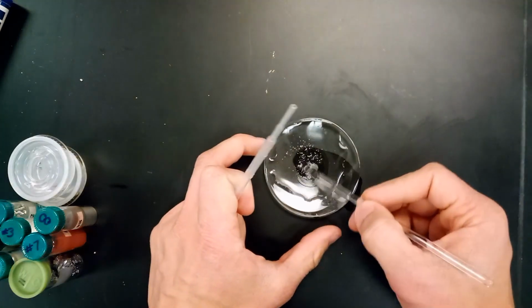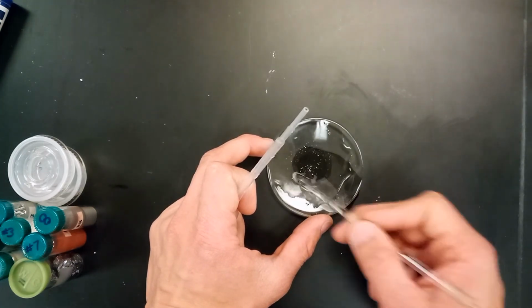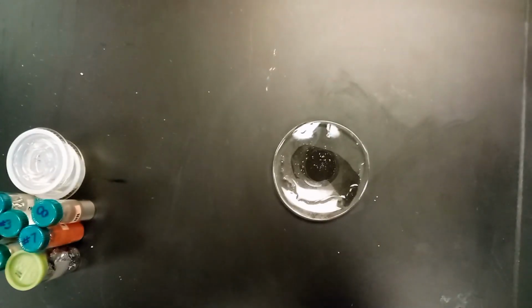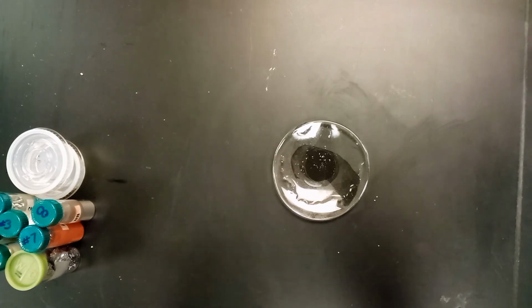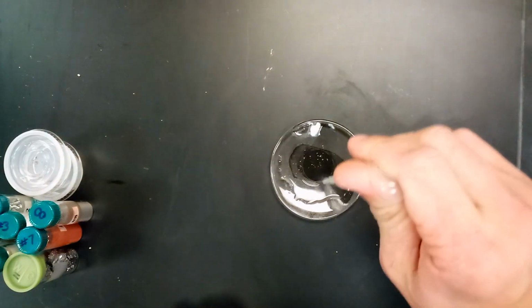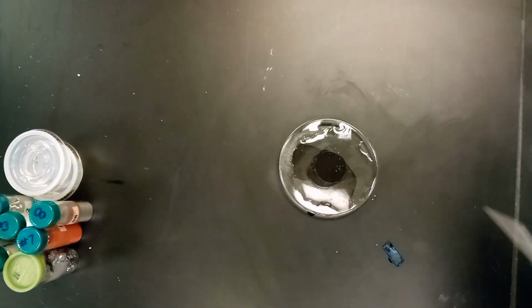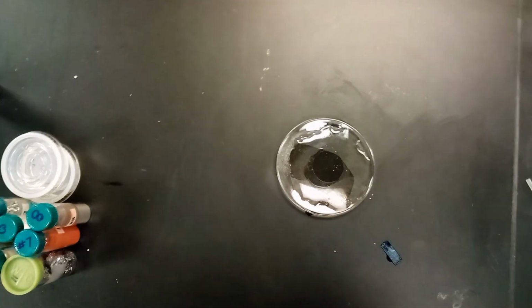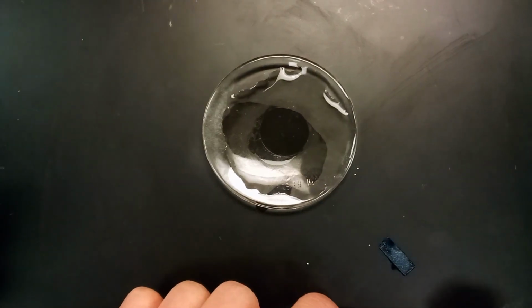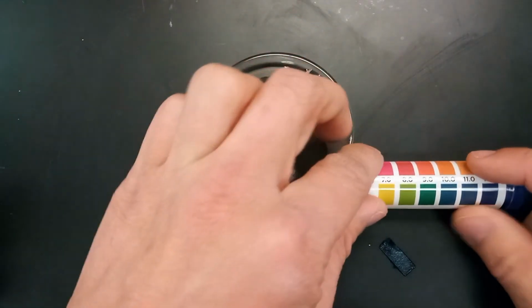But the thing we do want to check, and we do hope works, is solubility and pH levels. So some of it does seem to be dissolving when you give it a stir, so that's a good sign. Let's grab a small piece of pH paper. We'll take some of our solution and pipette it onto the paper. So that's much different than what we've seen in previous ones. The strip is right there, which clearly is blue. The other ones we've been seeing have been orange, red, yellowish, even green. This is blue, so we have our indication chart.